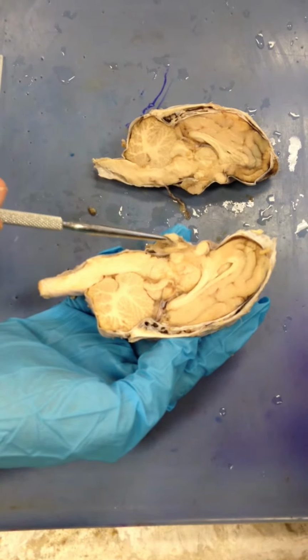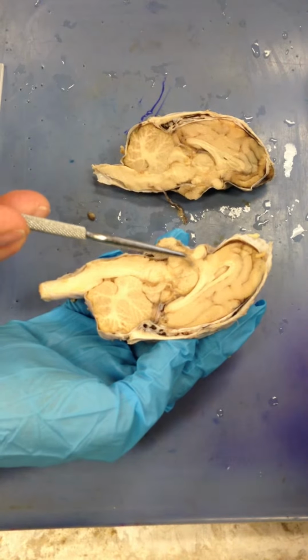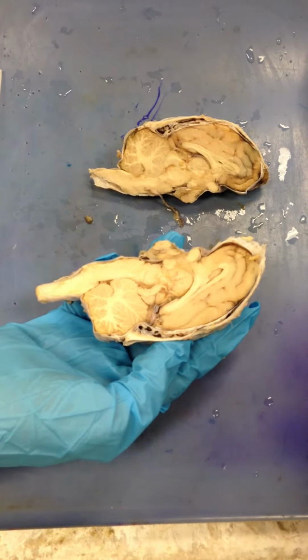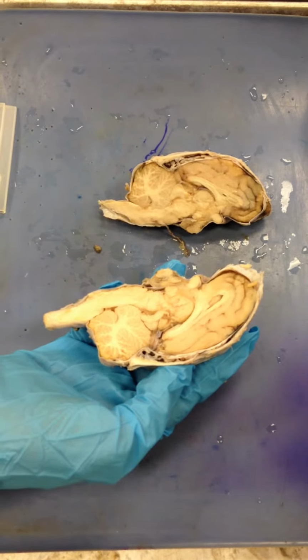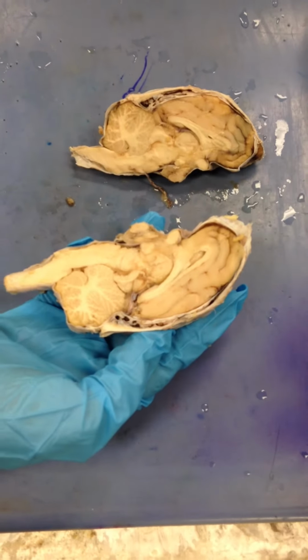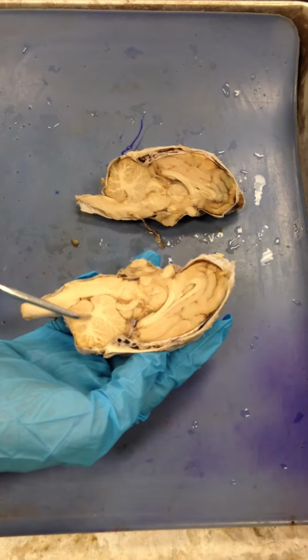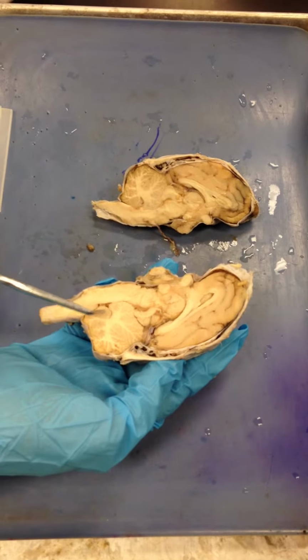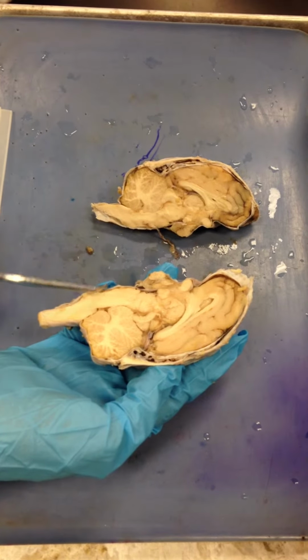The stem of the pituitary is in very close proximity because the pituitary and the hypothalamus reciprocate, back and forth. A lot of communication between those two components. So the white matter shown here is your arbor vitae, and the gray matter is the folia, respectively components of the cerebellum.